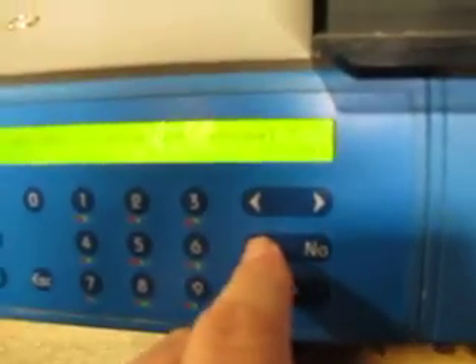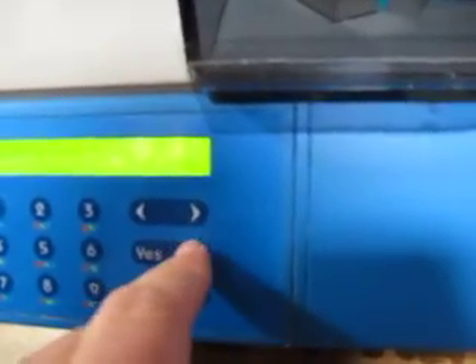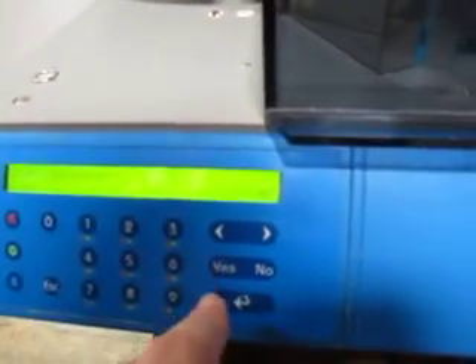This says five — unload: yes, empty column: yes. If you want to load carousel: no. Prime the pump: no. Calibrate pump: no. Start dispensing: yes.